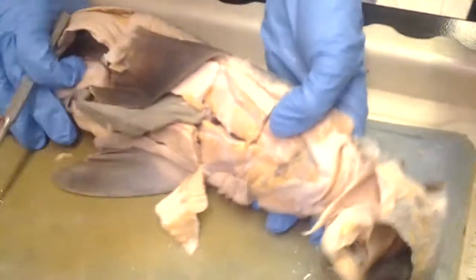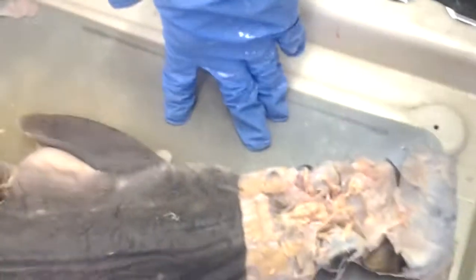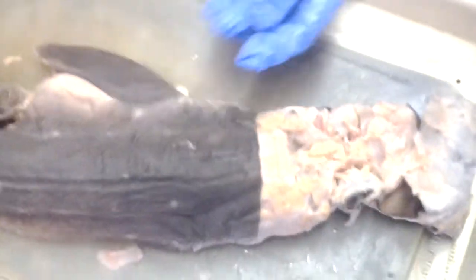We're not going to be tested on any of the nerves except for the ones you just went over. Out of the big long list of 10, we only need to know the optic nerve, the superficial ophthalmic, and 5 and 7, and that's it. But you should study the diagram because some of them are very easy to identify.